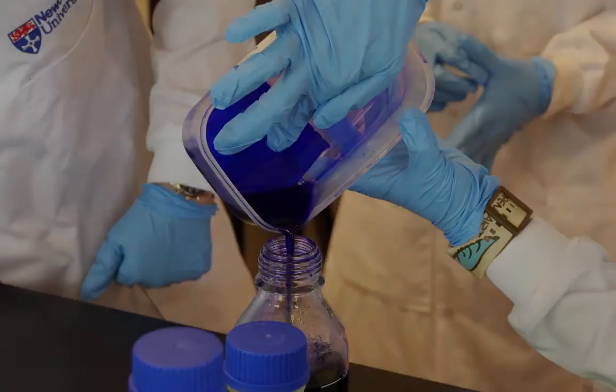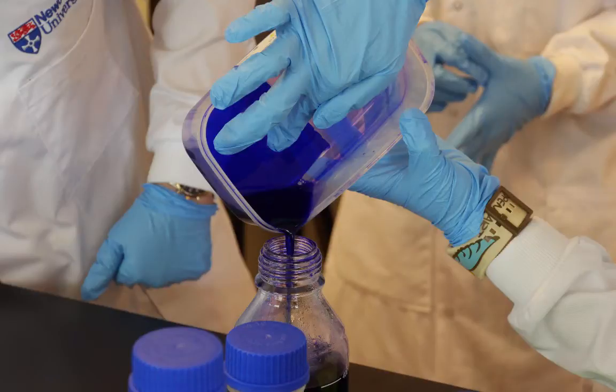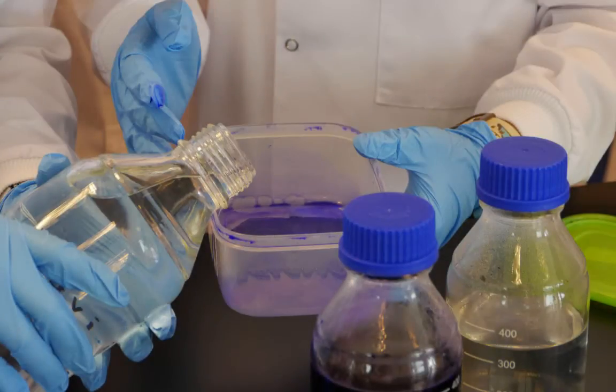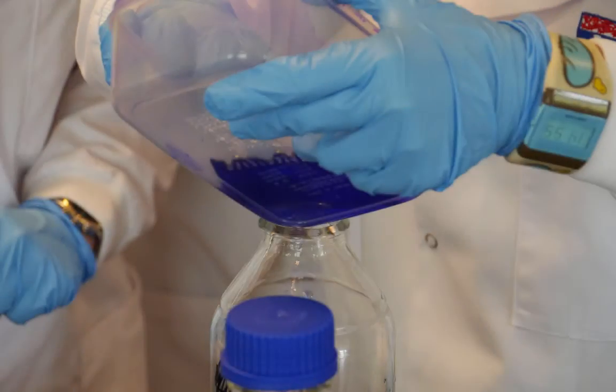The dye was carefully poured off and a small volume of de-stain added, which was then poured off to remove excessive stain.